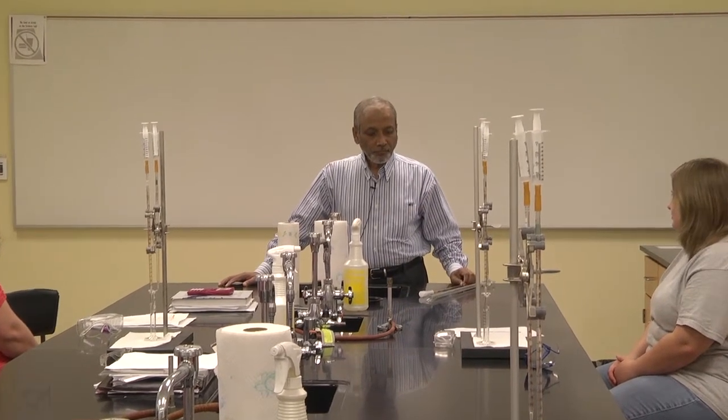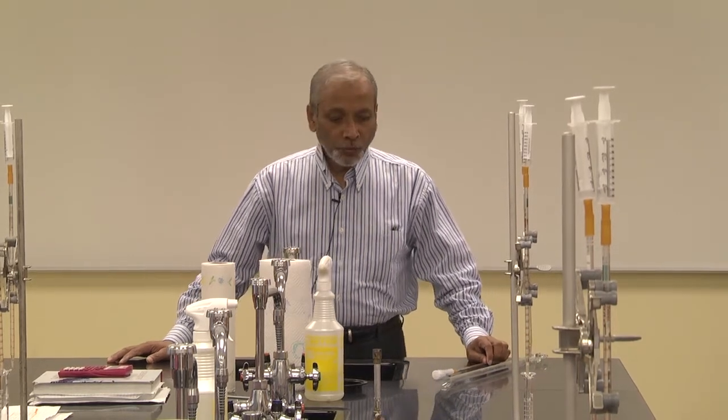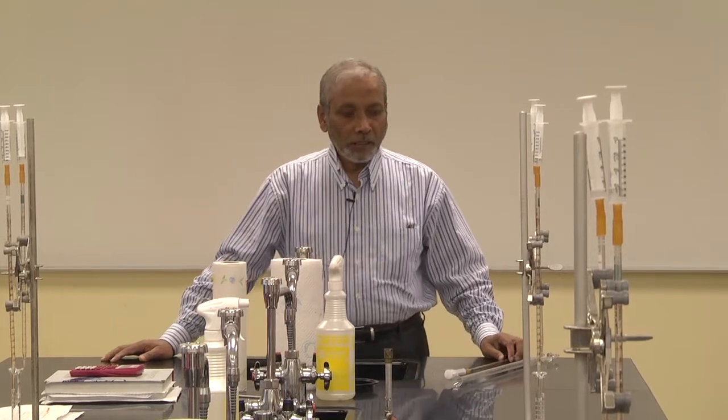So you will titrate vinegar, and then you will use sodium hydroxide to titrate it. So the vinegar will be titrated with sodium hydroxide by using phenolphthalein as an indicator. Okay? So today's experiment also is related to something we have learned in the class.